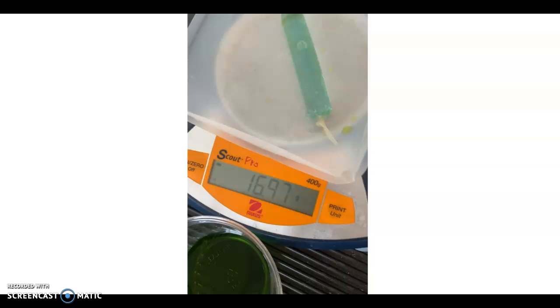Okay, so that's basically what we did in the lab. It was pretty straightforward, not a lot of moving parts. So just based on this part of the video, you should be able to answer all of those lab questions under the data section and the first conclusion question.